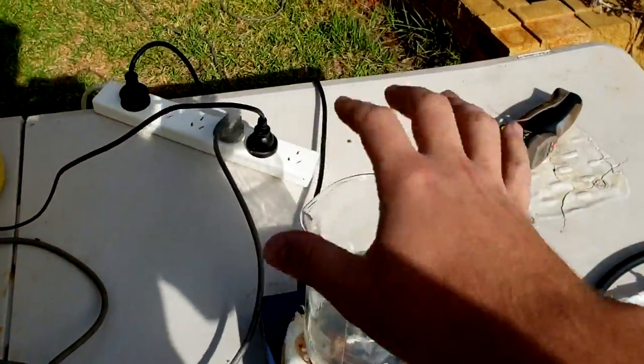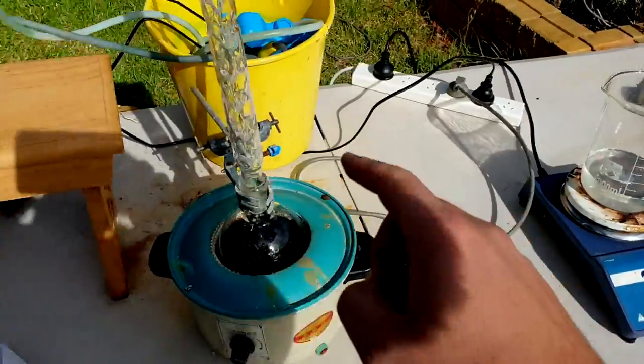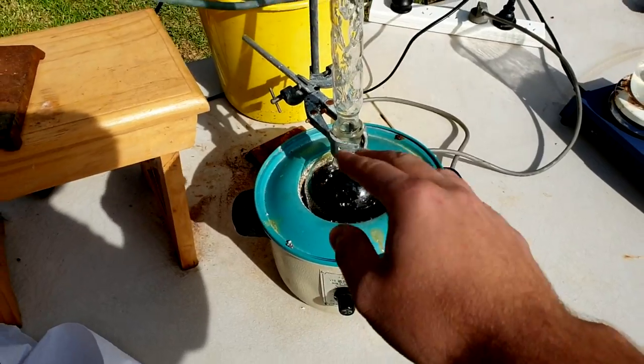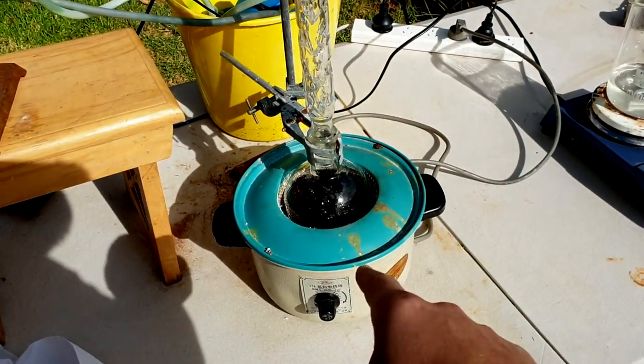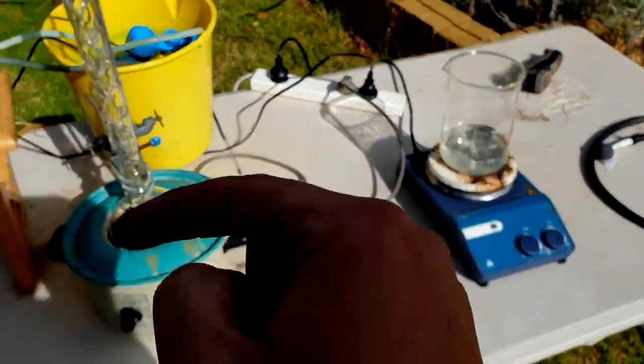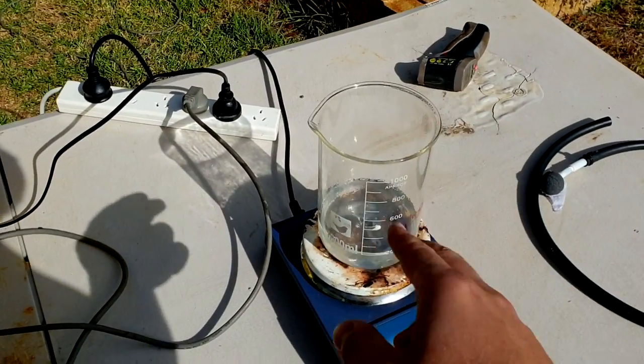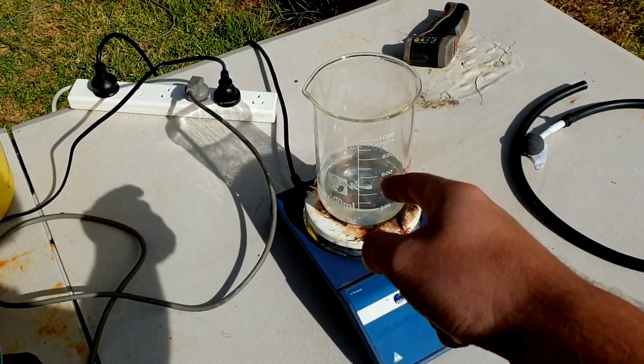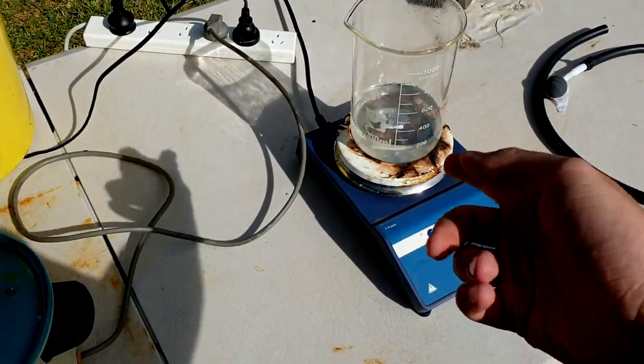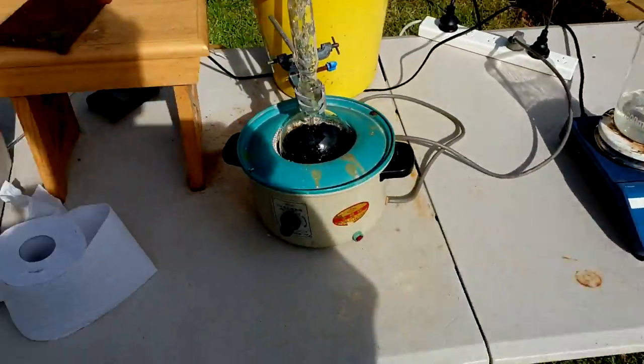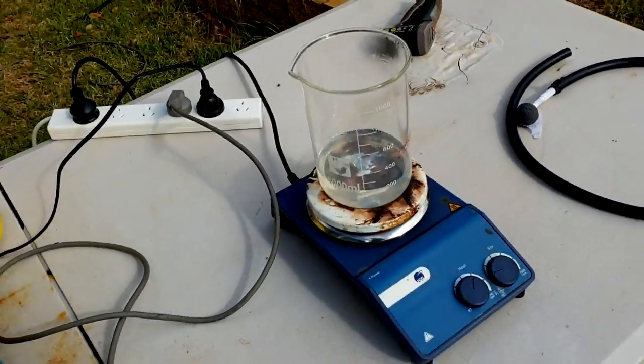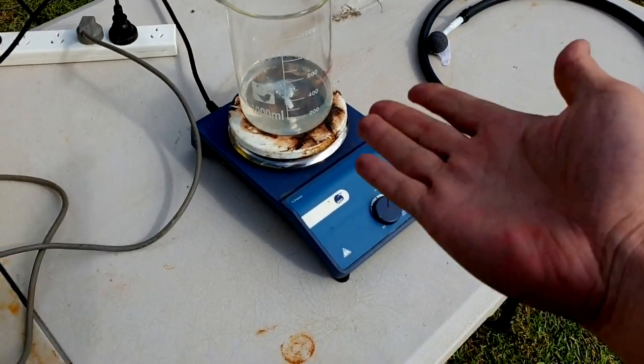And it nearly was a lot worse because it had the lid kind of half on, so it didn't get on the electronics. I had this covered with the plastic wrap, so none actually got in there. And this hot glassware got sprayed with water, too. So, it could have easily smashed, and it could have destroyed the heating mantle. But, no glass cracked, the heating mantle seems to be fine. And for all those people who consistently ask me, why did you dye the condensed water green? It was for exactly this circumstance. Because, it was all this green water on top, but I couldn't have known if I got any water in there if it wasn't dyed. But the fact that it didn't go green meant that no water actually got in there. And it was easier to clean up when it was all green. Hopefully this boils down and we get a little bit of the ammonium nitrate, or just a little bit of solid at all.